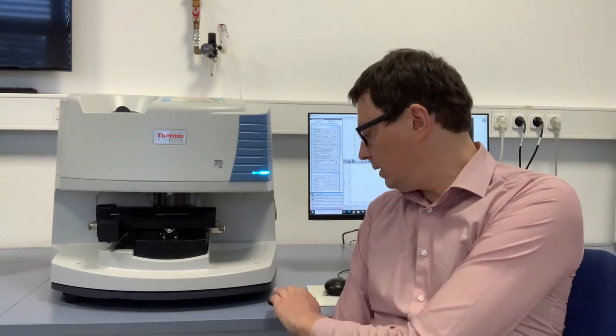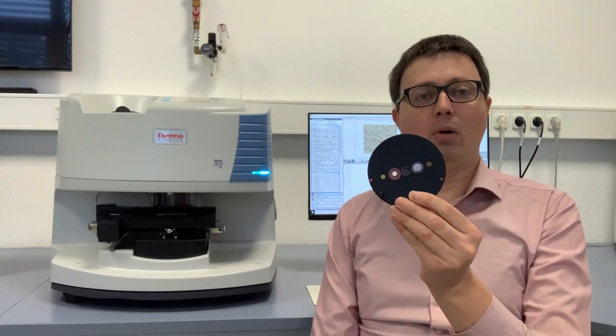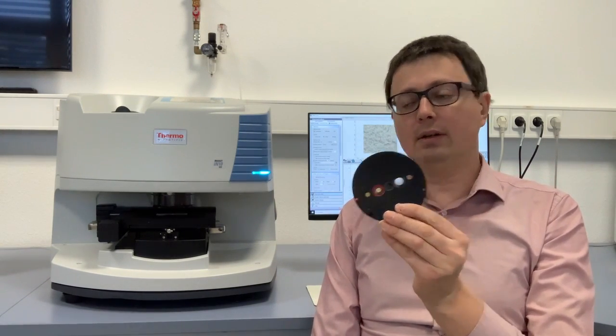Our IN-10 is also suitable to be operated in a pharmaceutical environment because we have a validation slide with traceable polystyrene standards, which help you to validate the system in transmission, reflection, and ATR mode with respect to the different pharmacopeias.